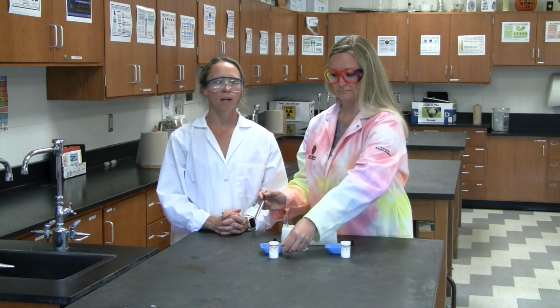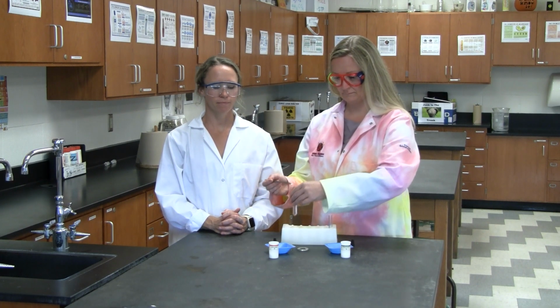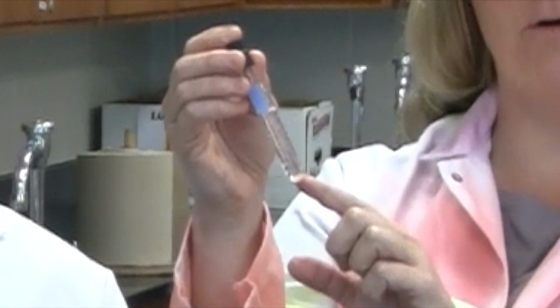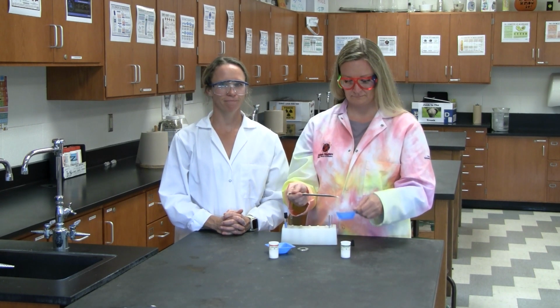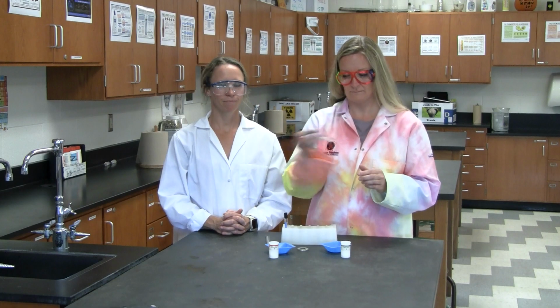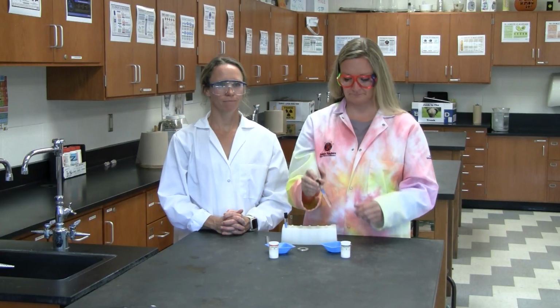We are now looking at the solubility in water for our two samples. We will add a small amount of the sample to a test tube with water, stopper, and shake. Here is sample A. You can still see the crystals floating around in the water. Record your observation in the data tables. Now for sample B. The crystals have dissolved in the water. Write that down.